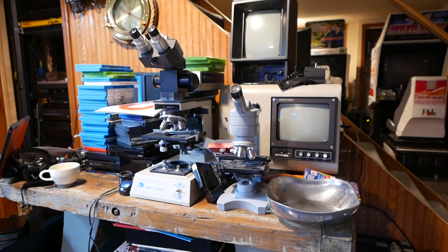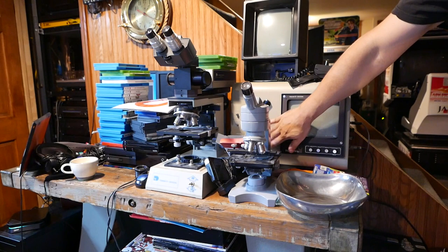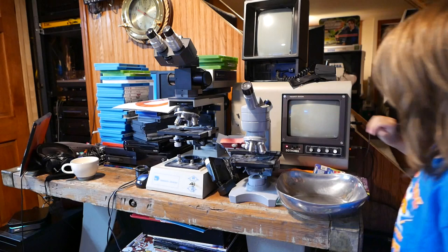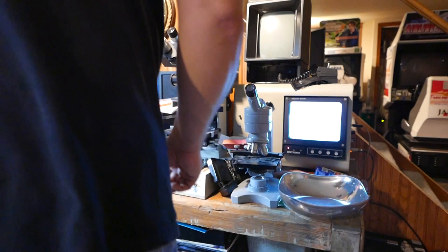Thank you. We're good. You want to turn this on? Yeah. Big switch right here? We got a lot of junk here. Big red switch. Like this way? Yeah, push. Just push. It is now on. Alright. Let's get things set up first. Too much junk.